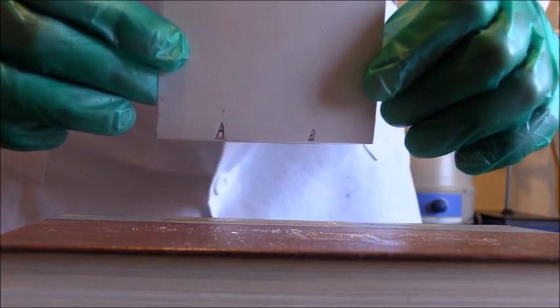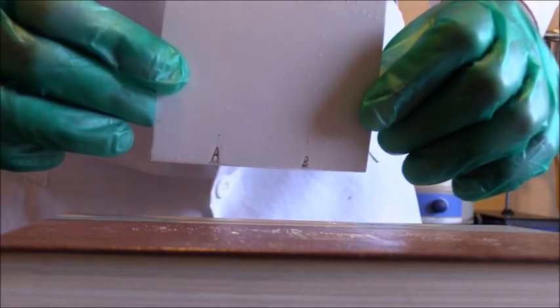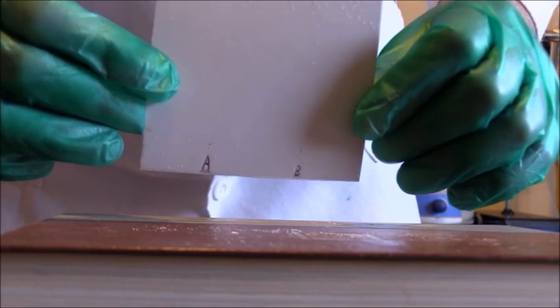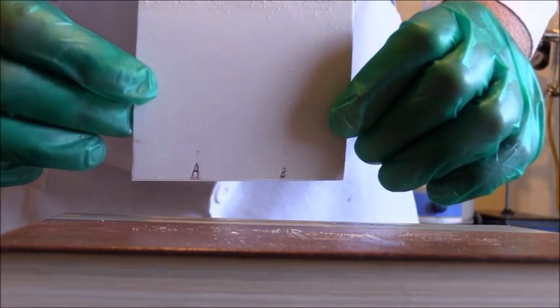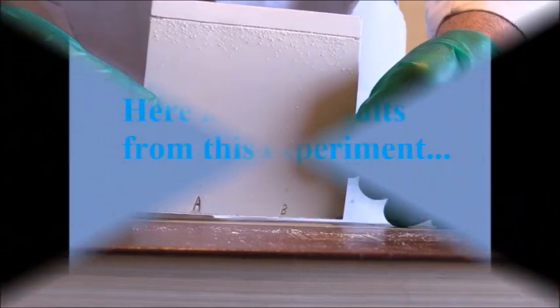I have to spray the plate with ninhydrin in order for the amino acid lines to show up. But basically, we're done with the test, and so I will be sharing the results pretty soon.